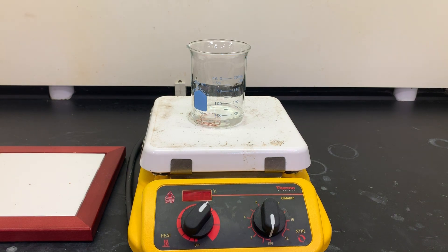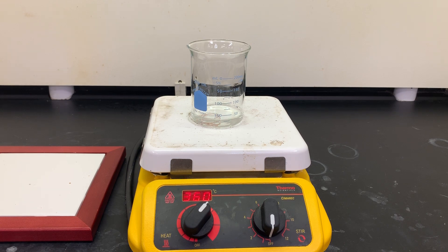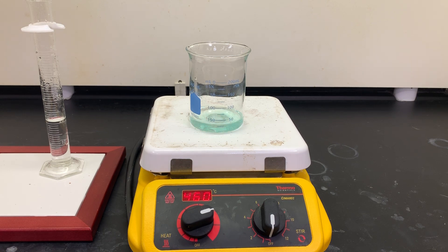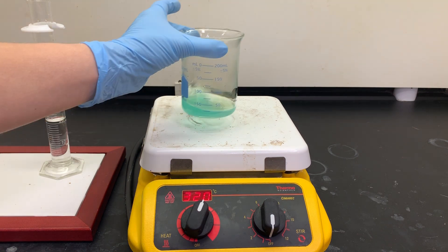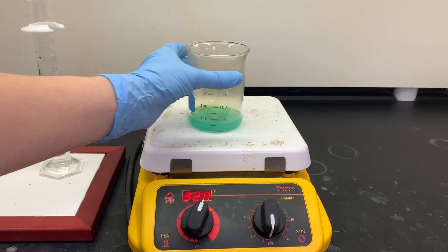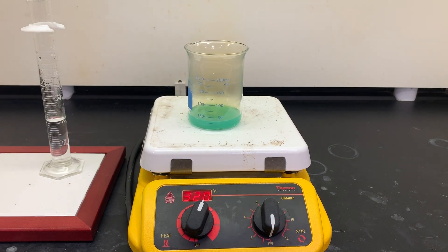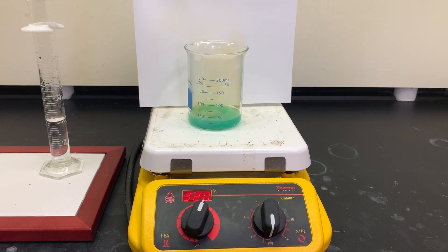Normally this reaction takes a little while to get started, so I'm going to speed up the video. Now I'll slow things down so you can make some observations. I'm going to hold a piece of white cardstock behind the reaction so you can see one of the products that's being formed.